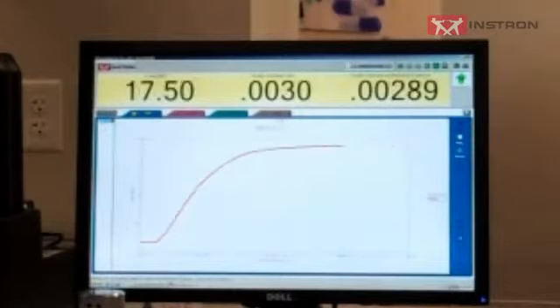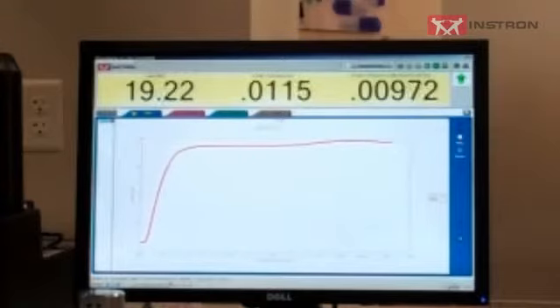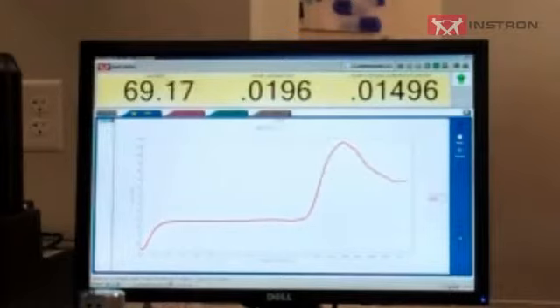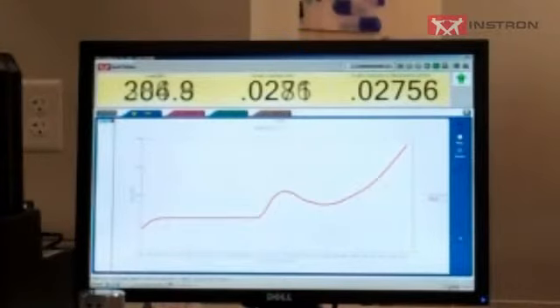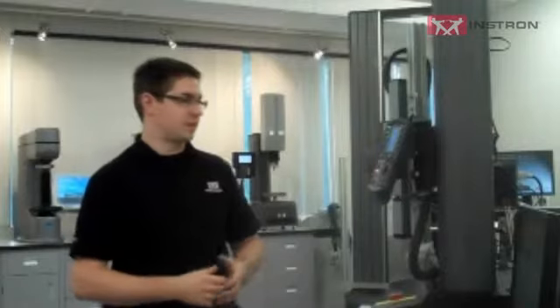So you can see there's a flat spot on the curve during the extension. That's actually just under 20 pounds, which is the weight of this grip. So it's actually lifting the lower grip through that compliance area. When we get to 500 pounds, you're going to see that it's gone about 33 thousandths of an inch just to get there. And a large portion of that was this compliance.